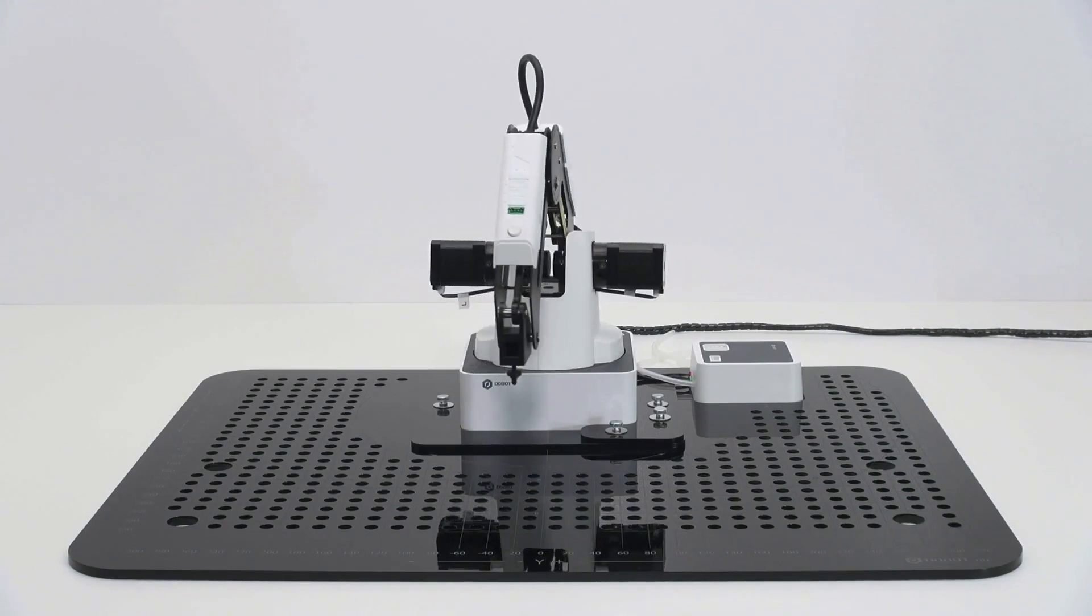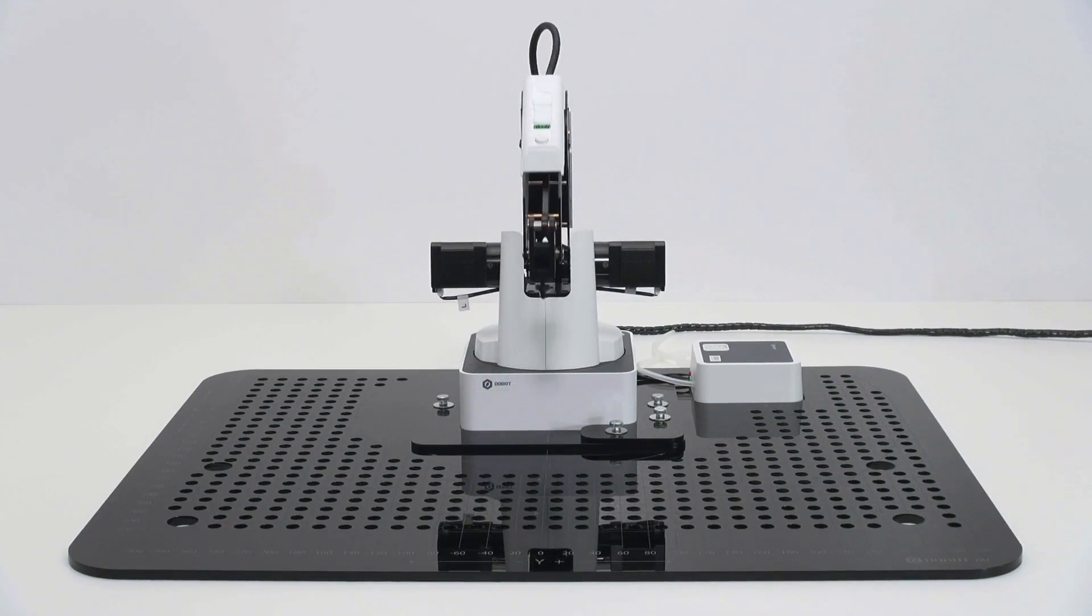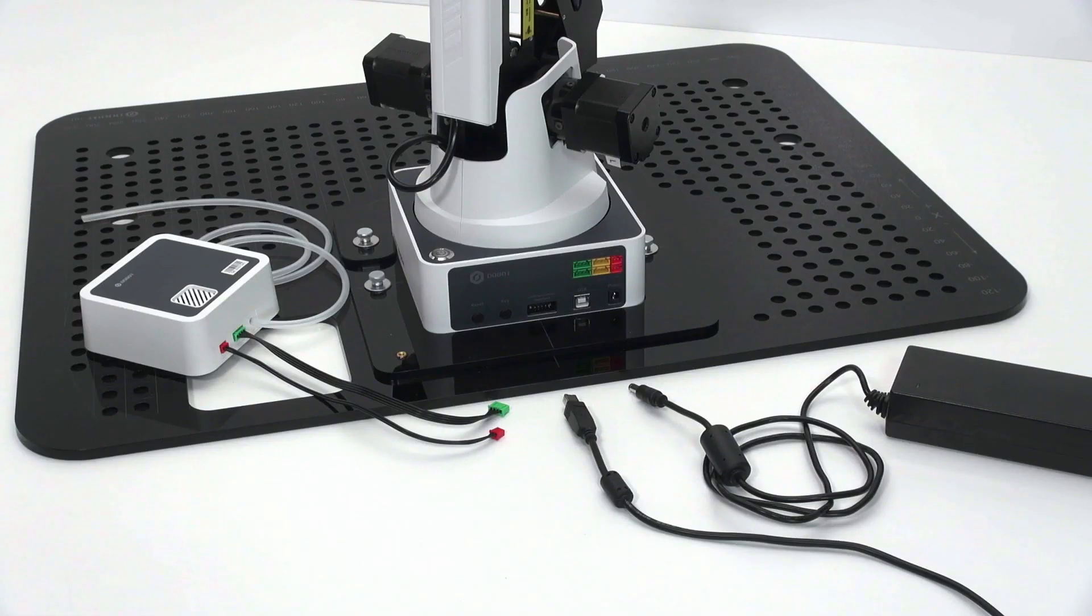Before you can start working with the robot arm, you need to fix the various connections. On the back of the robot arm, you find most of the connections.